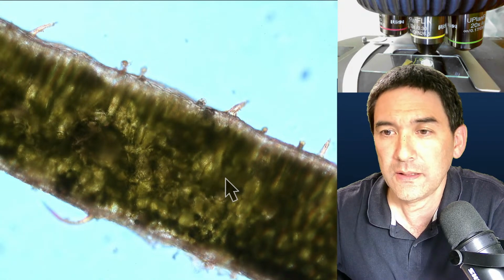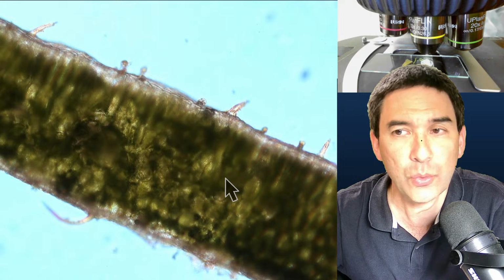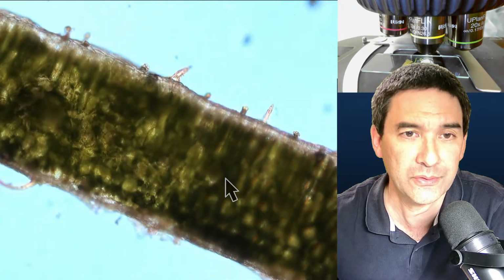And all of the questions here, what are the little spikes on the sides of those leaves and so on, all of these questions I'll try to answer later on, okay?